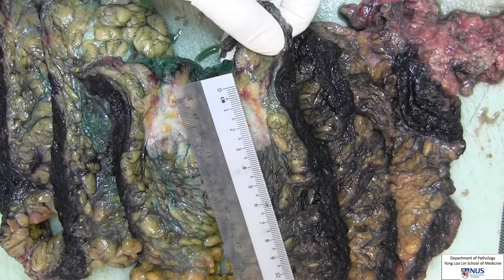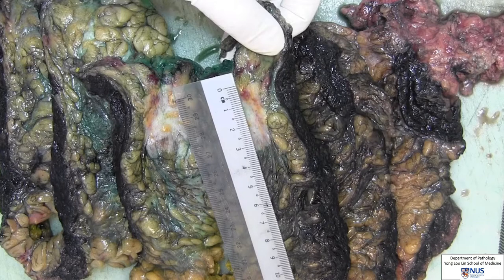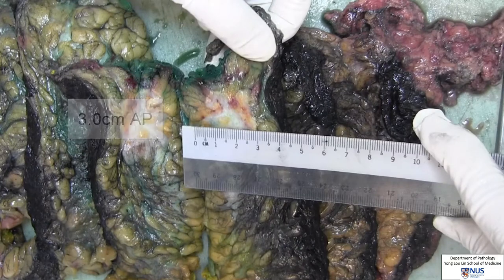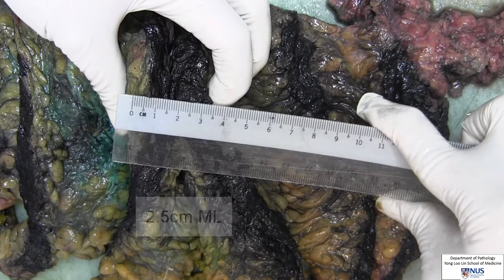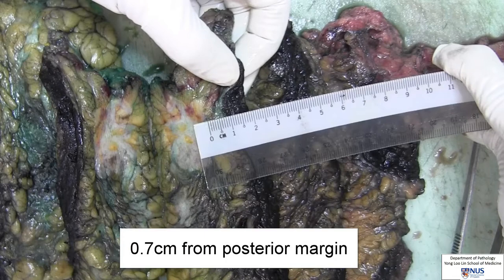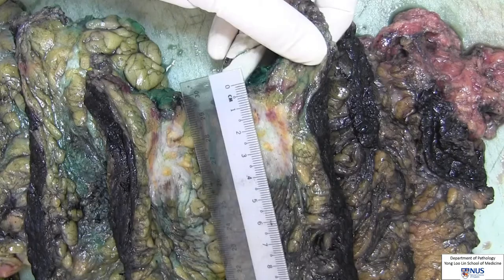The tumour measures 3.5 cm from superior to inferior, 3 cm from anterior to posterior, and 2.5 cm from medial to lateral. The tumour also measures 0.7 cm from the posterior margin, and 0.5 cm from the superior margin.